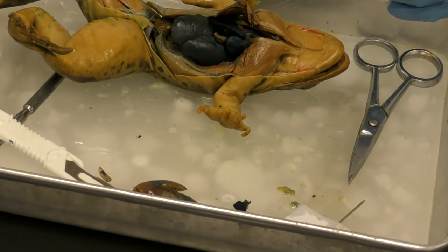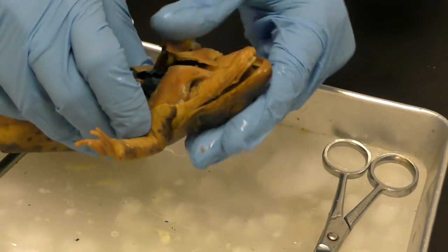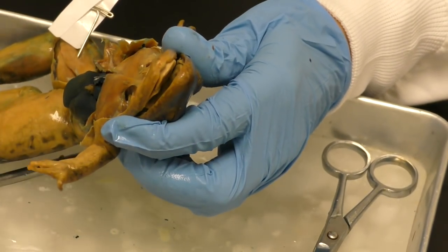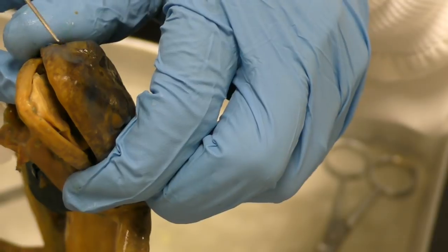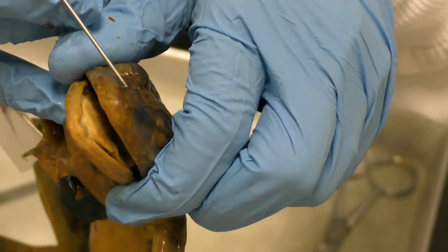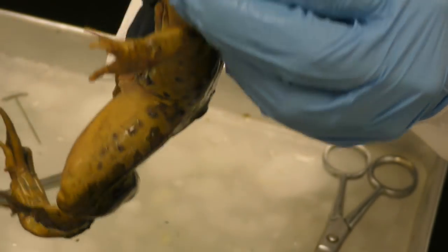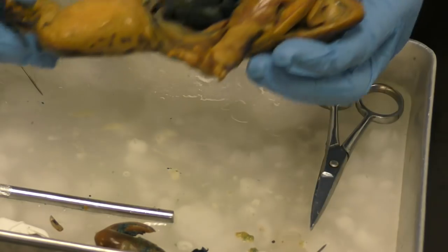All right, so we've done digestive system. All right, the next thing that our frog has is these little holes called external nares on the outside of its body. And let's see, so much like your nostrils, okay, so there's one, and that provides one route of getting oxygen in and carbon dioxide out, okay, and then there is the trachea located in the mouth for it to also breathe. Frogs are unique, they also can breathe through their skin.